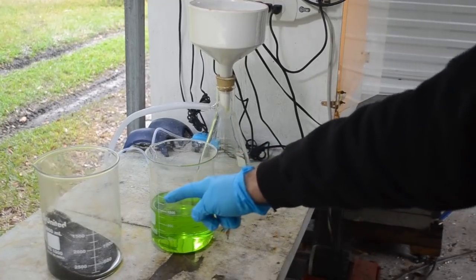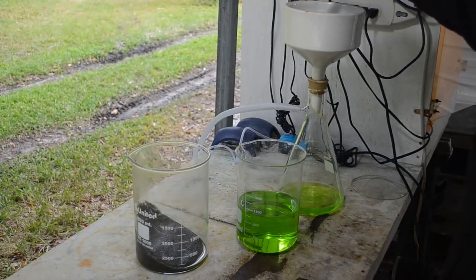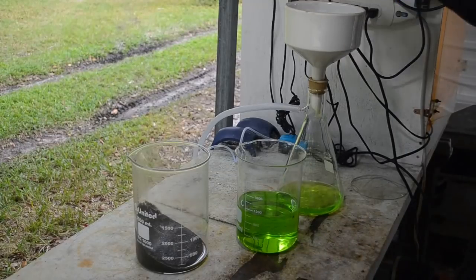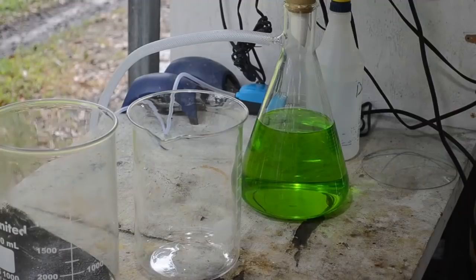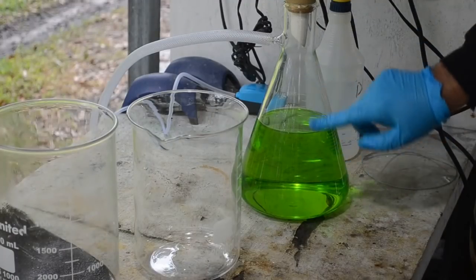Then I'll put the solids over here into the filter and let the vacuum suck the residual liquid out of them as I wash them with the distilled water. We'll get all the pregnant solution out of the solids too. Alright, second time through the filter. That did the trick. This is nice and crystal clear now.